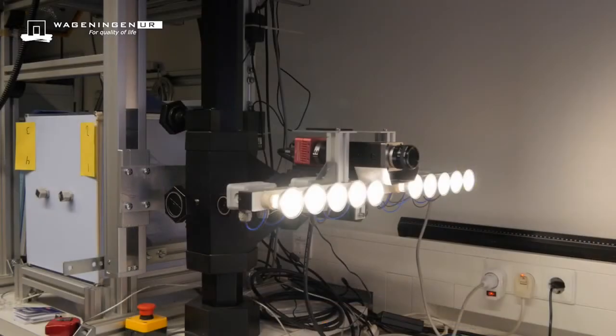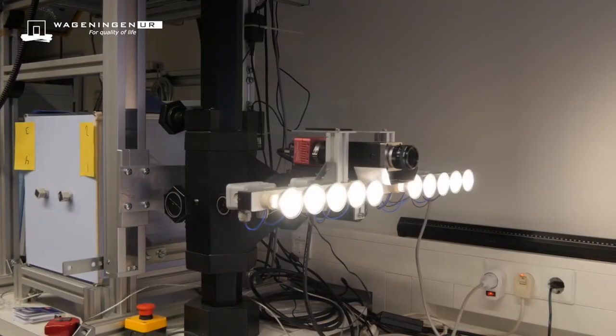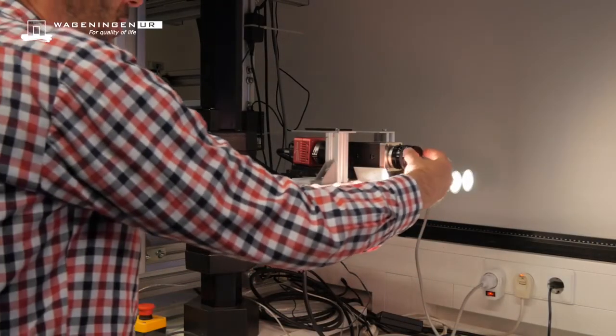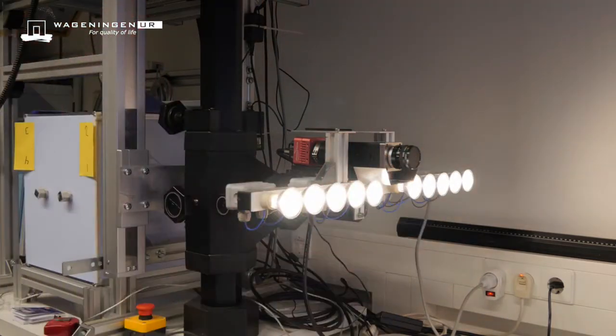We need to calibrate the system using black and white reference images. The black image is captured while closing the lens cap, and the white reference is a standard white object with constant reflection over the whole spectral range.